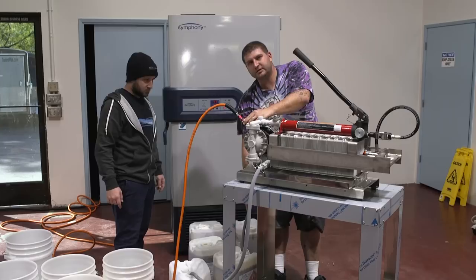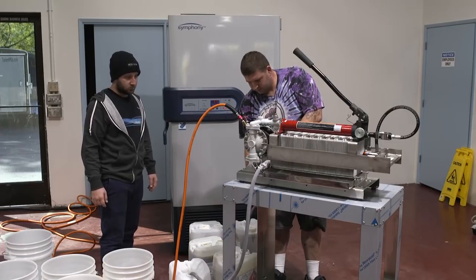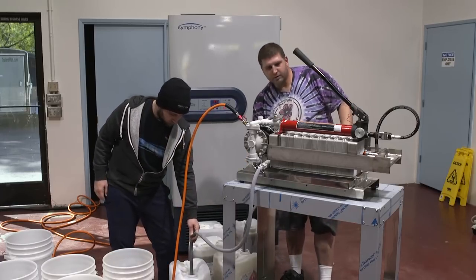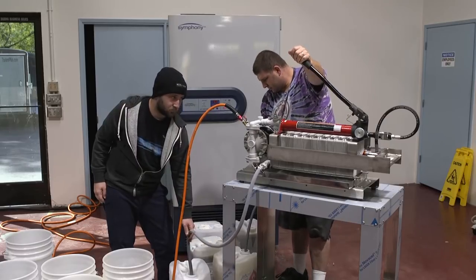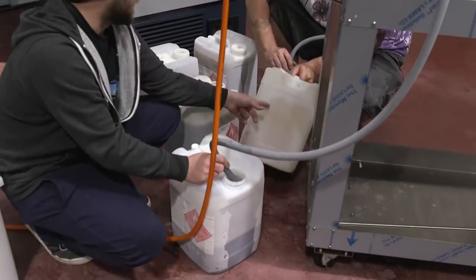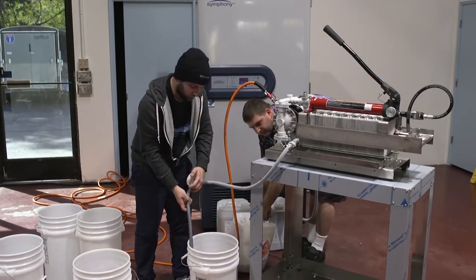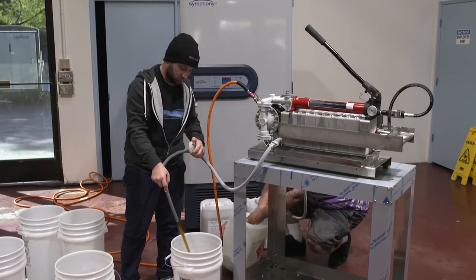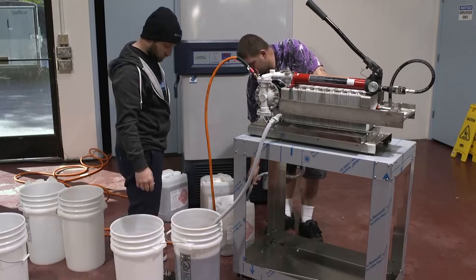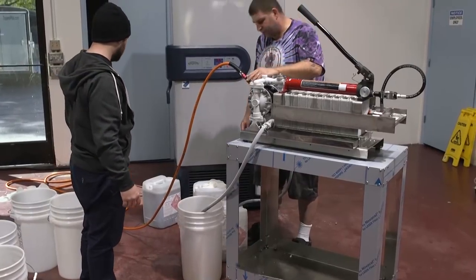Now we're going to re-engage with our wax material. As you can see, the plate system is relatively loaded and there's more pressure, so we increase the pressure on the compressor.